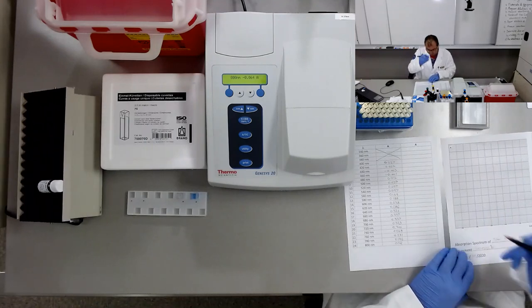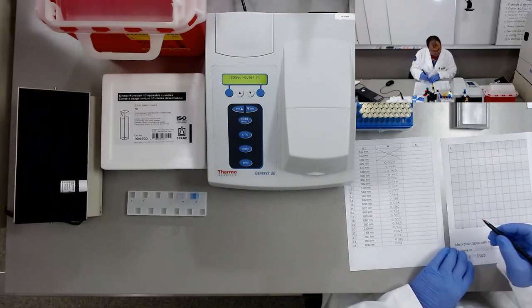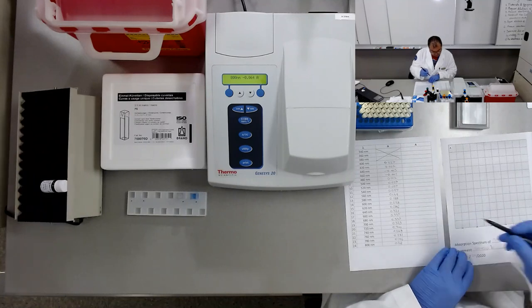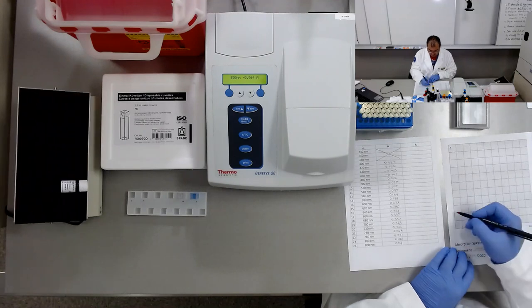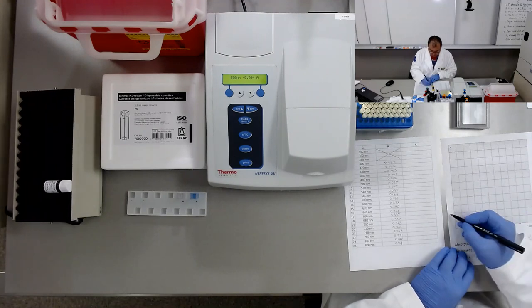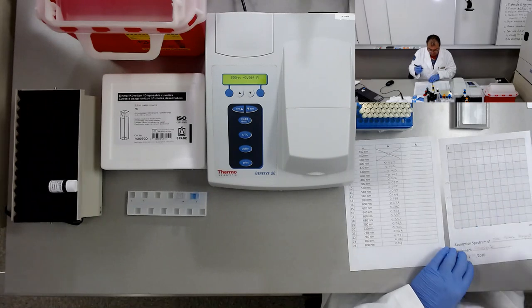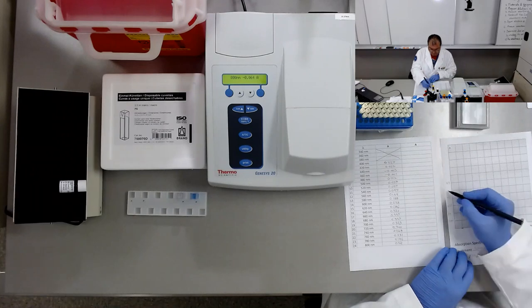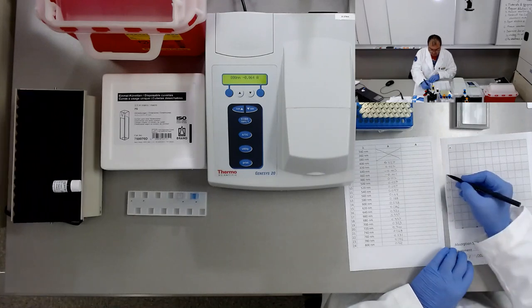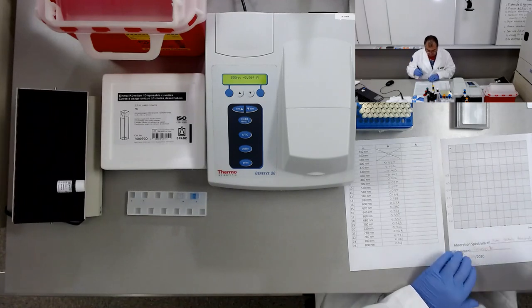We are going to set up the y-axis, where the maximum value is 0.337. So 0.1, 0.2, 0.3, and in between 0.05, 0.15, 0.25, and this one 0.35. We start from here, 400 nanometers, and we go up.